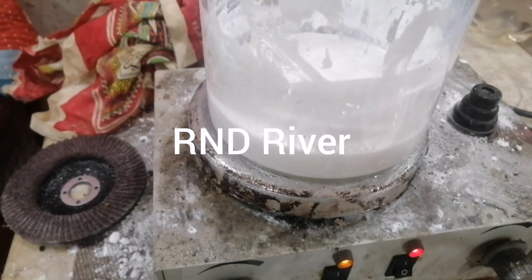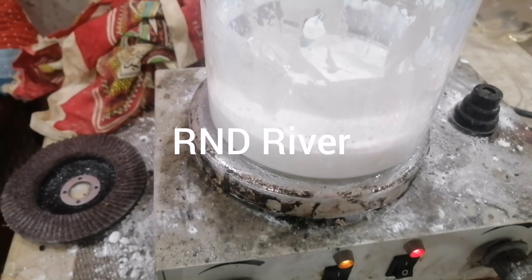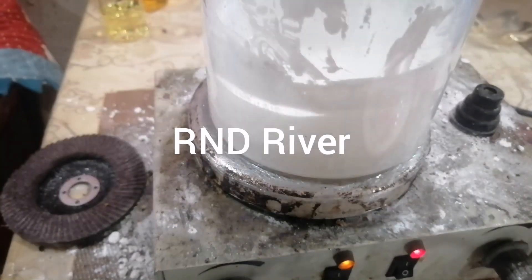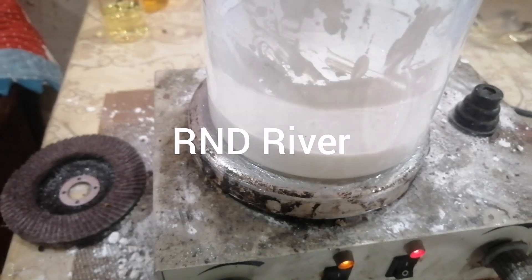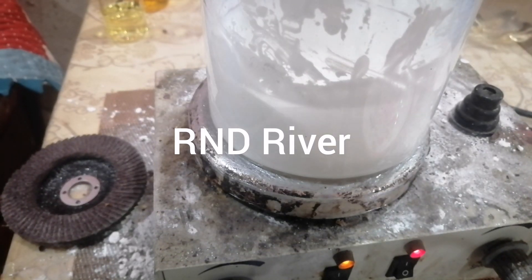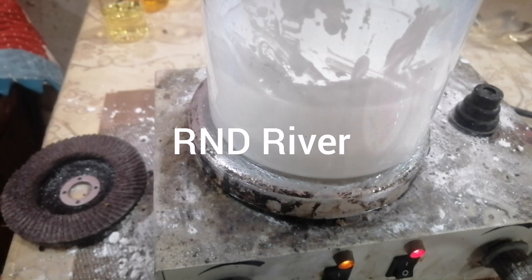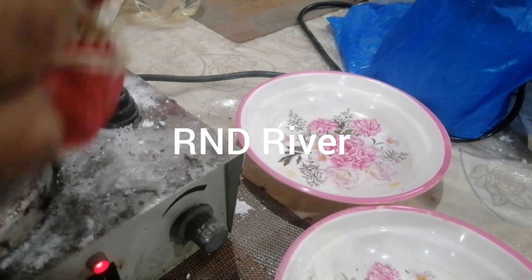The moisture has been dried — I think there is no more moisture. The total process will take 4 to 5 hours. It depends on the heat level you are using. If your heat is high, it will complete in 4 to 5 hours; otherwise the time may increase.